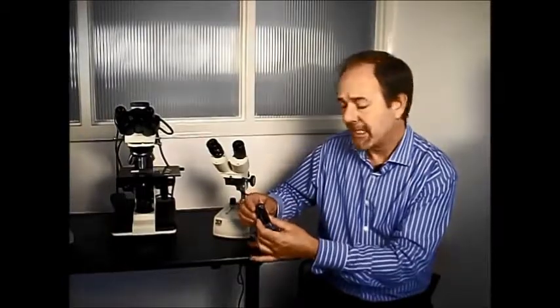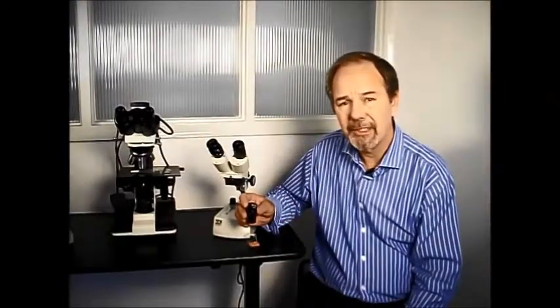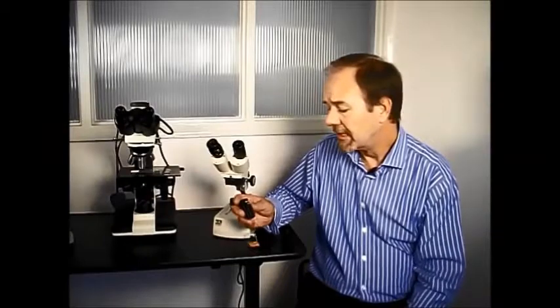Also, you might find some numbers printed on the outside of the eyepiece. These have nothing to do with the eyepiece reticule diameter either. The numbers refer to magnification of the eyepiece and the field of view. Normally, the reticule is slightly larger than the field of view to allow it to be fitted. Now, finding published information on the correct diameter to fit your specific eyepiece can be difficult.